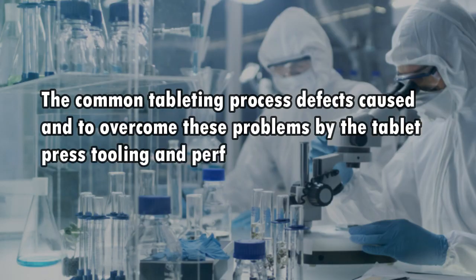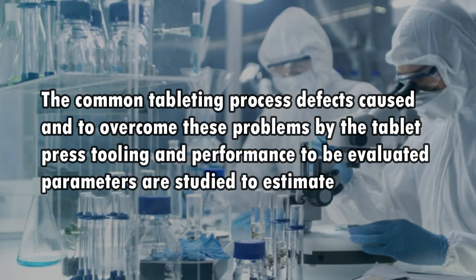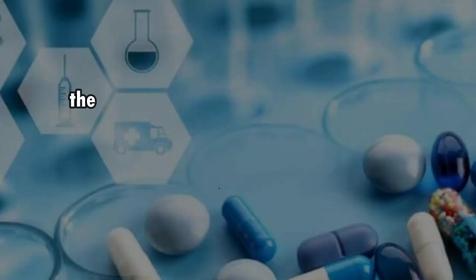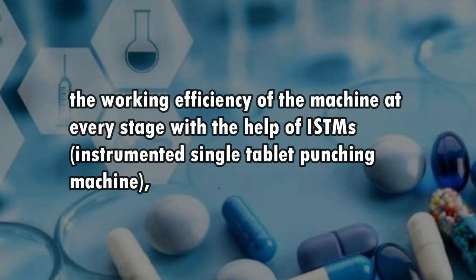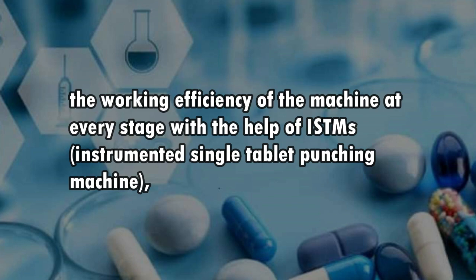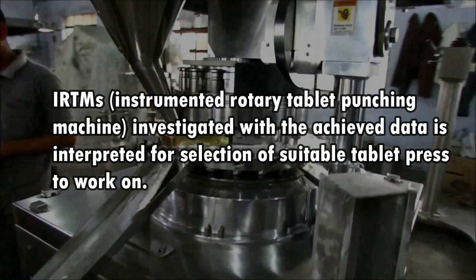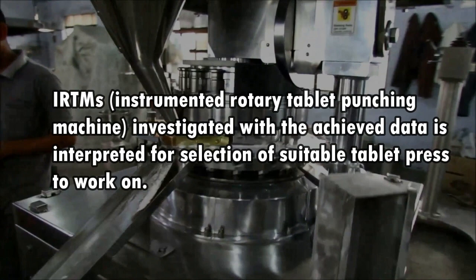The common tableting process defects and ways to overcome these problems through tablet press tooling and performance evaluation parameters are studied to estimate the working efficiency of the machine at every stage. This is done with the help of ISTMs (Instrumented Single Tablet Punching Machine) and IRTMs (Instrumented Rotary Tablet Punching Machine), and the achieved data is interpreted for selection of a suitable tablet press to work on.